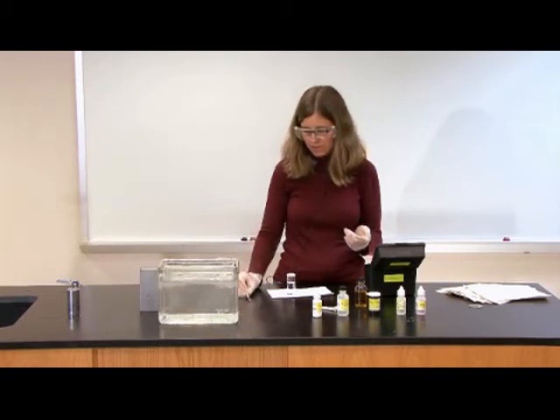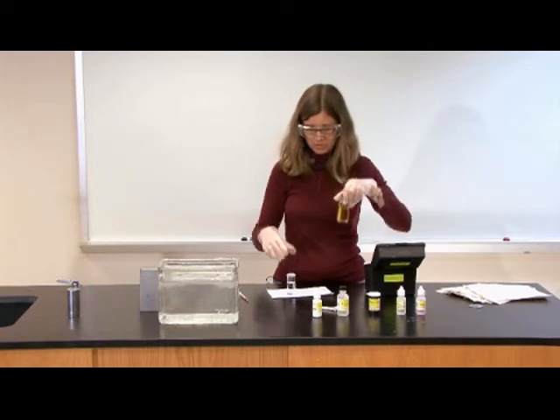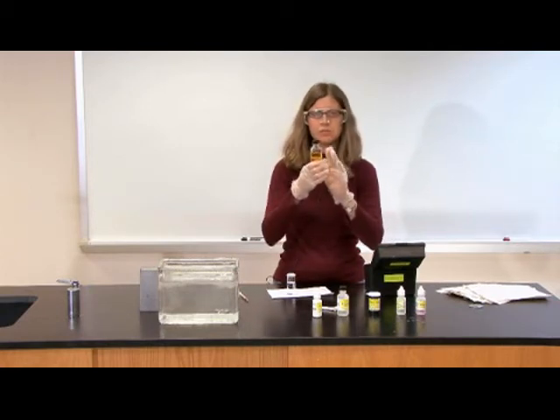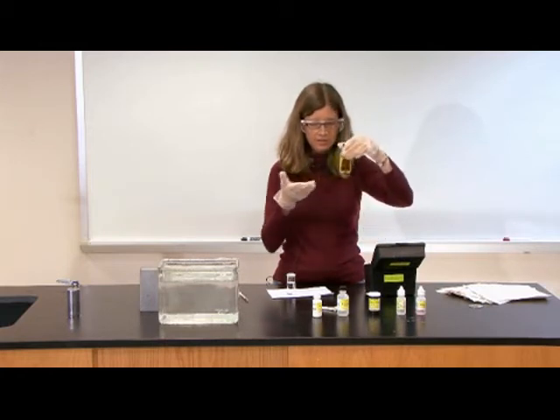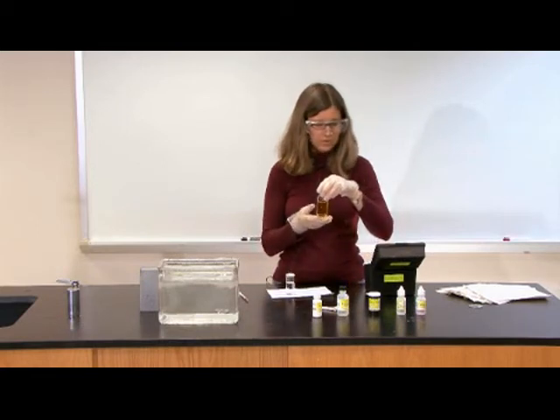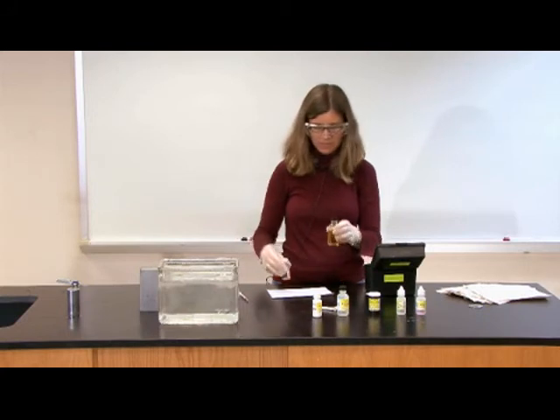Once again, you would want to do this measurement twice. So remember, we did our sample preservation. This sample is fixed. And so this sample is here waiting. I can measure it later. A good practice is to do the actual test procedure.